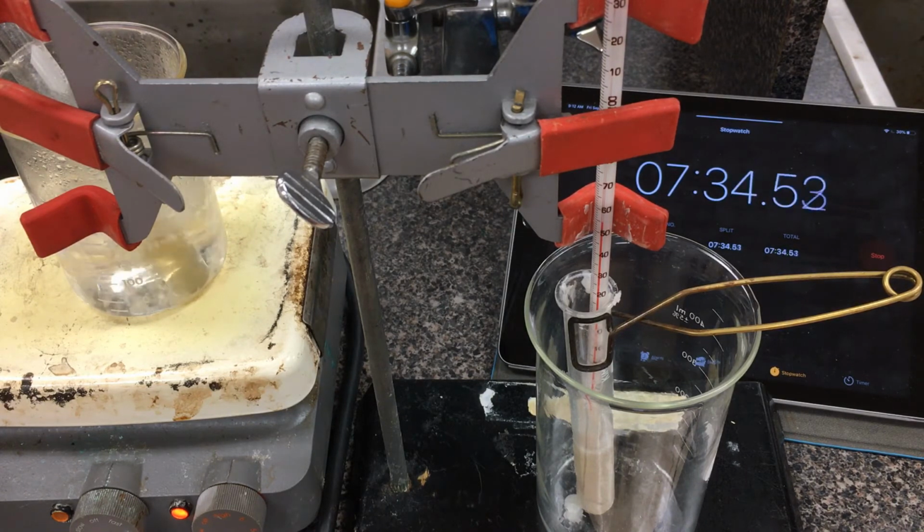Alright, so I'm noticing that the stearic acid here has started to solidify. You can actually start seeing it qualitatively here inside the test tube. The temperature here is still 53.5. Again, there's nothing magical about us going in 5-second intervals. I just wanted to give you some detail as it started cooling down. We're going to eventually be plotting temperature on the vertical axis, time on the horizontal axis, and that way you can plot a cooling curve. Hopefully where the temperature actually steadies out is the freezing point for stearic acid. You can make a comparison to the literature value and see how we did.